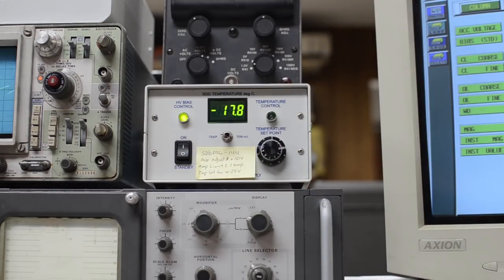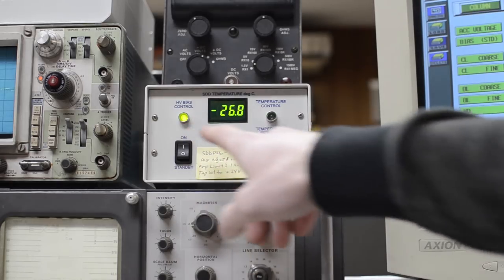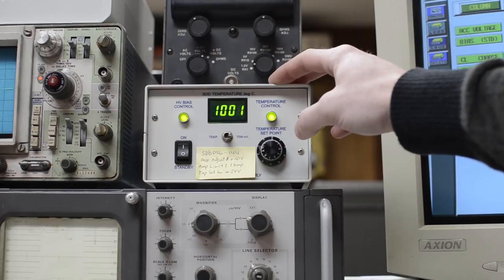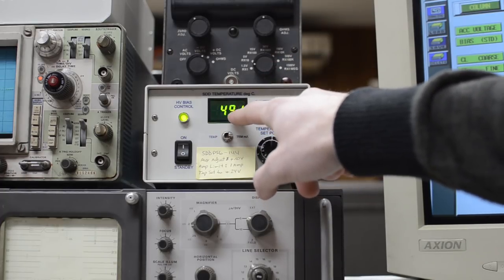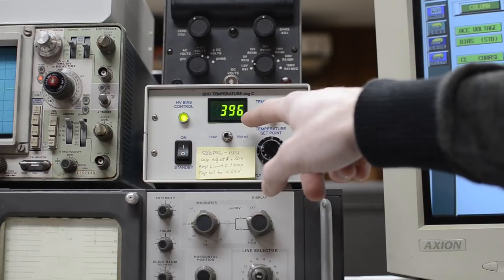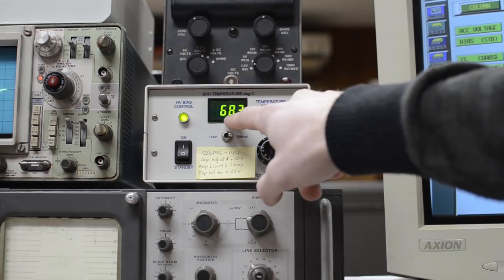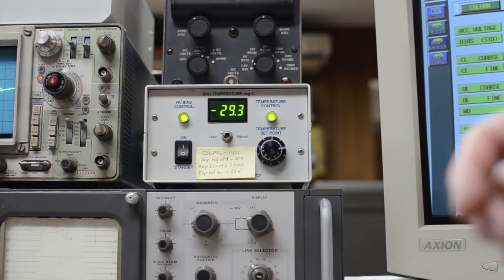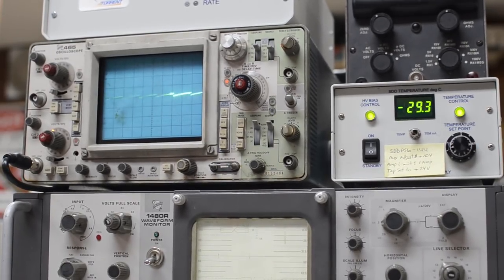I just flipped on the Peltier module, and it's reached minus 10 C, so the high voltage bias is flipped on. If you flip this on too early when you don't have a vacuum in the chamber, things can arc. The set point's at roughly minus 30 degrees C, which is where it should be. The cooler's drawing one amp. That will come down to about 600 or 700 milliamps. Once it settles around 700 milliamps, we should be about negative 30 C. We're ready to go. This is where that waveform will appear once there's actually an X-ray spectra in the chamber.